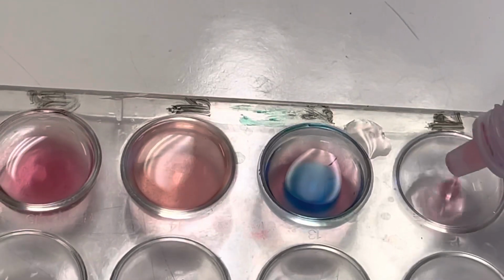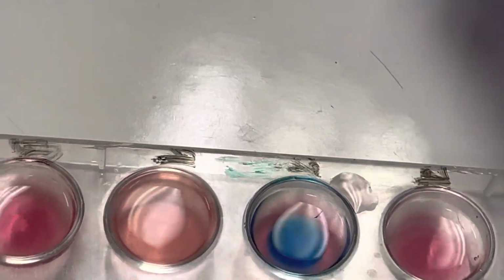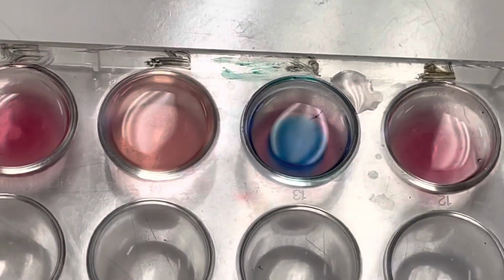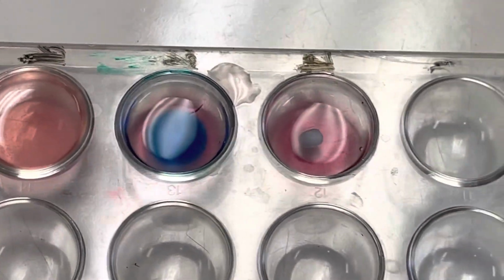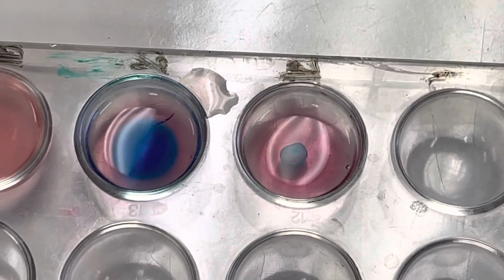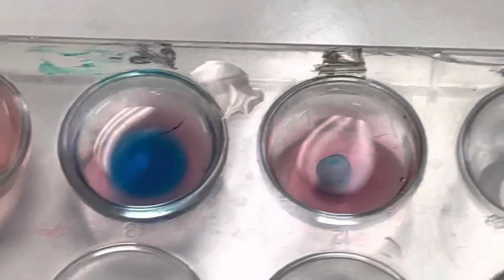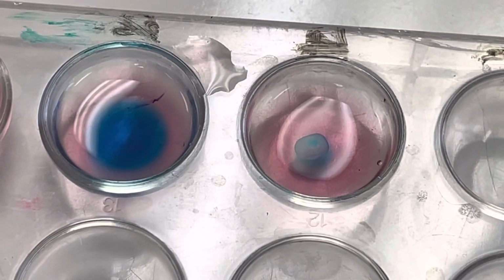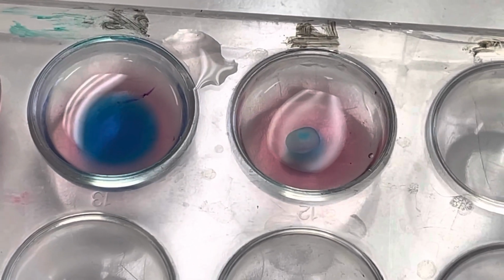Okay, once again, let's do our last one. So that's just the cobalt solution again. Oh no, we have 2 more. We're gonna do the calcium chloride now. Our calcium chloride is a solid. These little white balls. We've seen these before back when we did our ionic versus covalent, classifying solids. Remember when we tried to dissolve it in water and we checked if it conducted electricity or not. So we can see this one as well. When I added that calcium chloride in there, the calcium chloride itself looks like it's turning blue. All that solution that's touching the calcium chloride is turning blue.